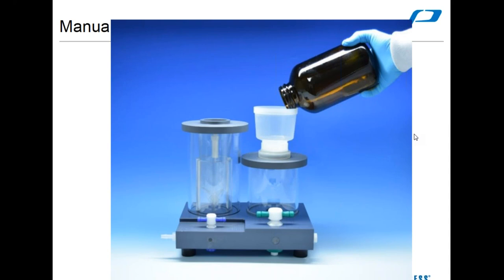How many apparatus can be hooked together at one time and still pull sample through? That's a really good question. Three will work. Potentially more than three can work. This can go along with the actual amount of air that your vacuum pulls. There is still a limit, a physical size limit on the channel that the liquid is flowing through. Because these are run in series, there is a physical limit on how much that can pull through at one time.